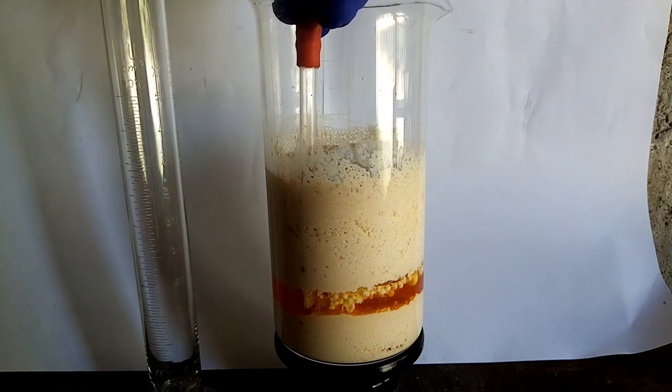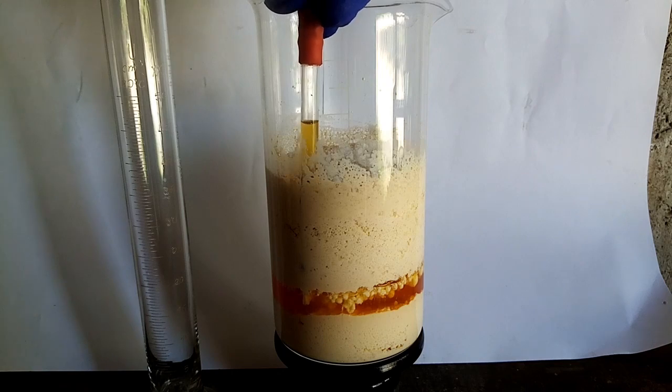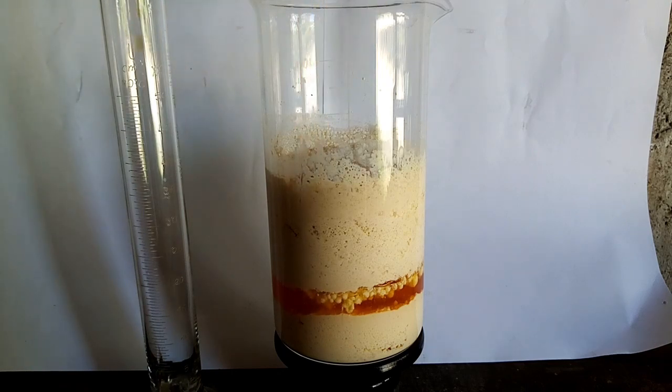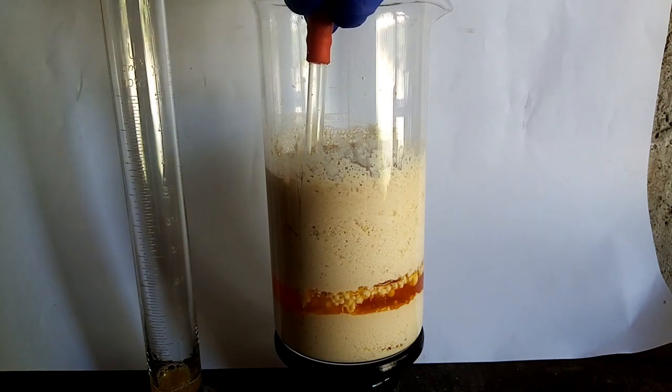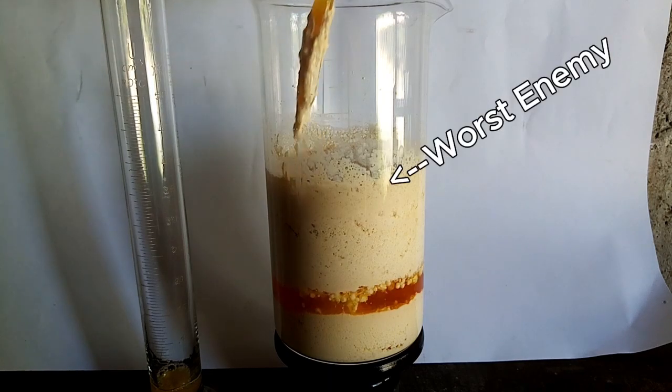This procedure was a really big pain because calcium sulfate is a really nasty chemical that is hard to separate out from other things. From now on I will declare calcium sulfate the biggest enemy of mine.